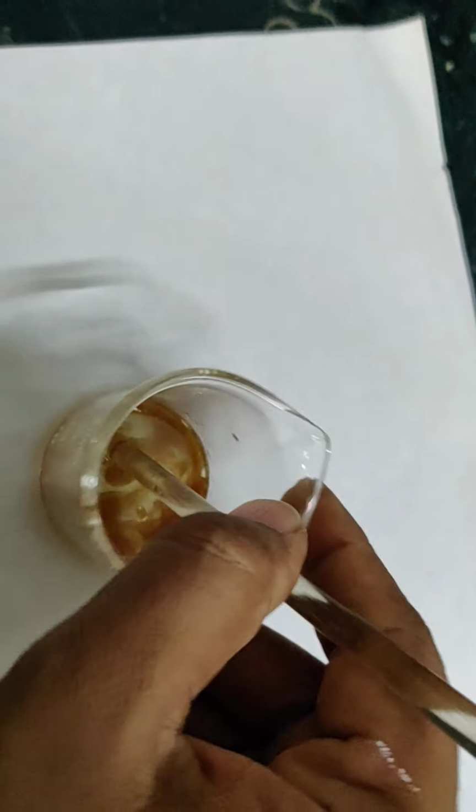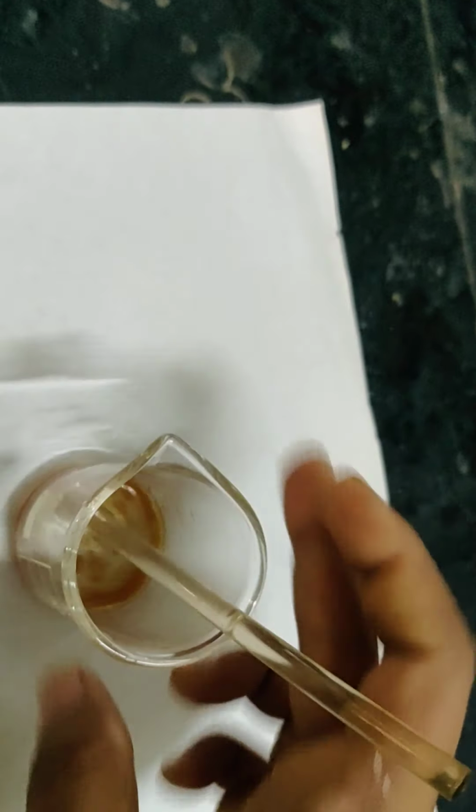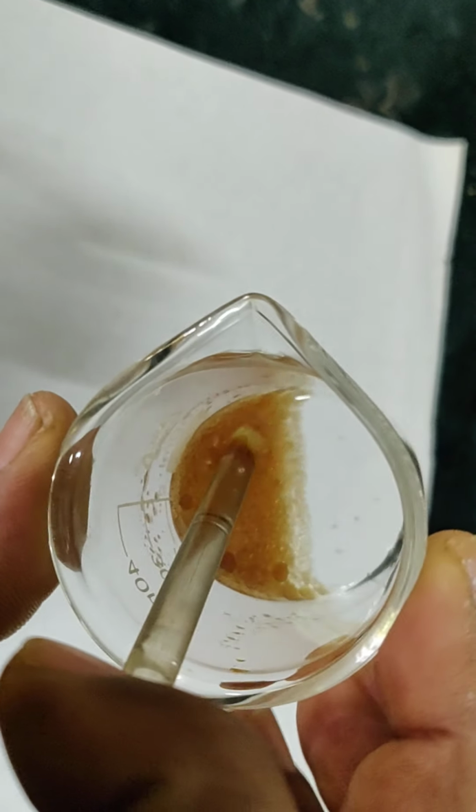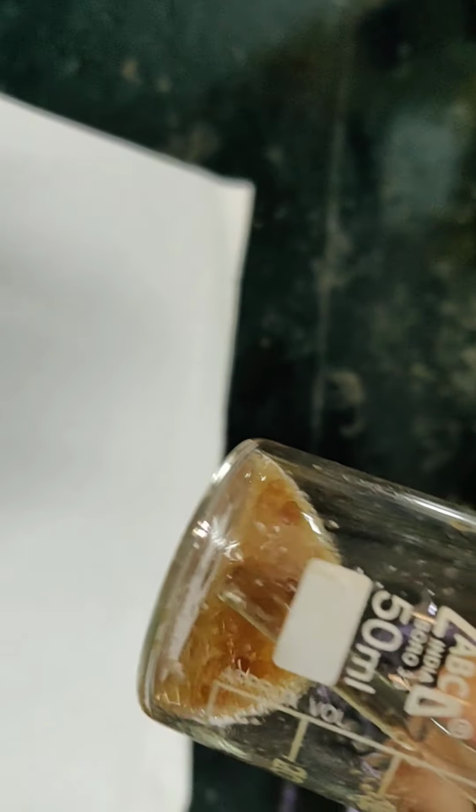But when you perform it, you have to use PPE in the chemistry laboratory, because chemistry laboratory work is all about observation. When you have to observe, you need good eyes, nose, and all your sense organs should be present and in nice condition. So now let us use one sense organ, our eyes.